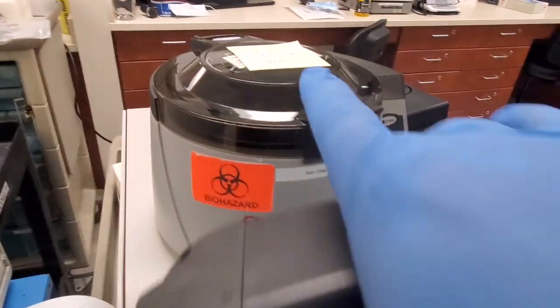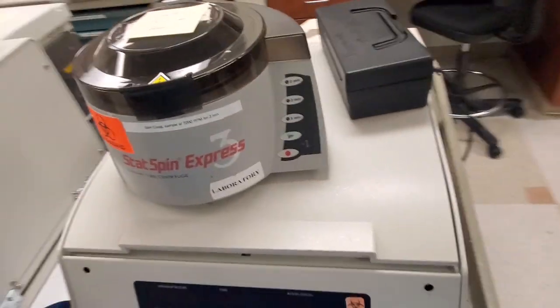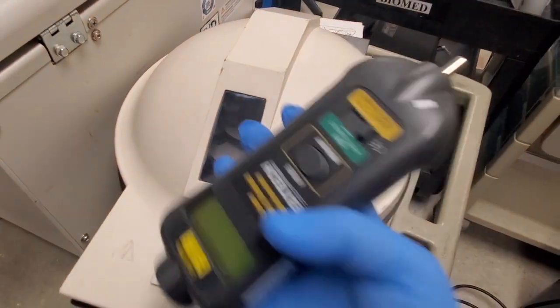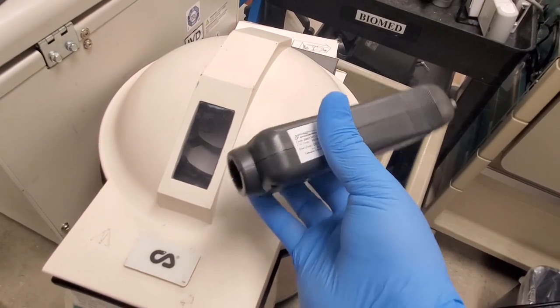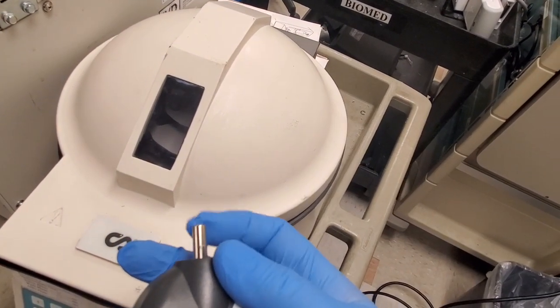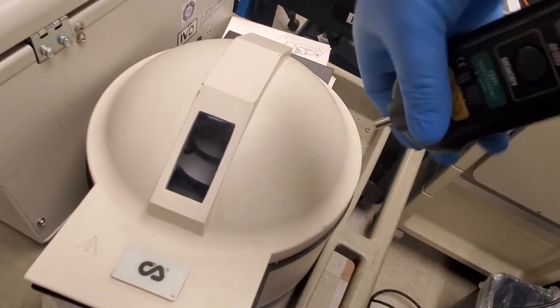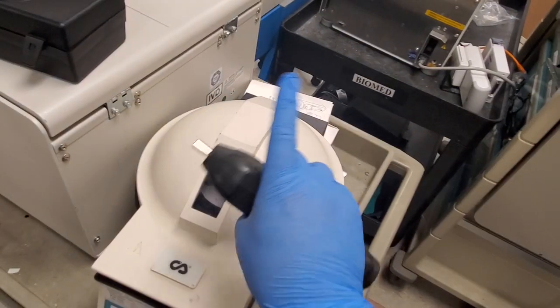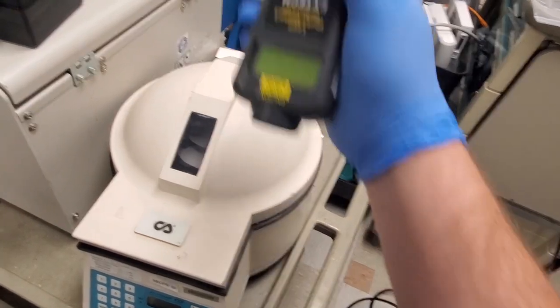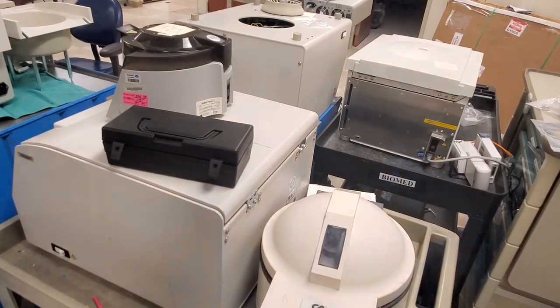You'll see they all have a semi-clear transparent dome so you can see the speed. We read the speeds either with a photo tachometer or a contact tachometer, which is this guy right here — it rotates and it'll show you the speed. You actually put this straight on the rotor, which is incredibly dangerous, so we don't actually do that. We almost always use a photo tachometer. But that is how we read the speeds on centrifuges.